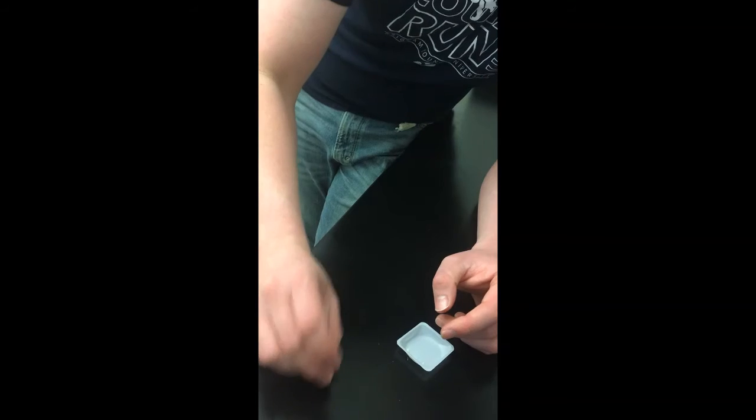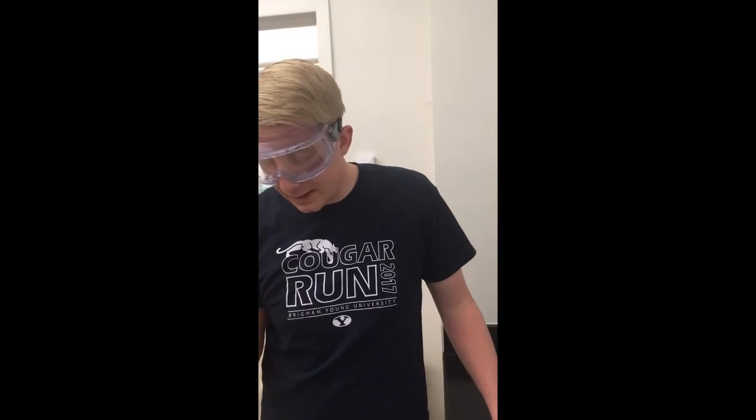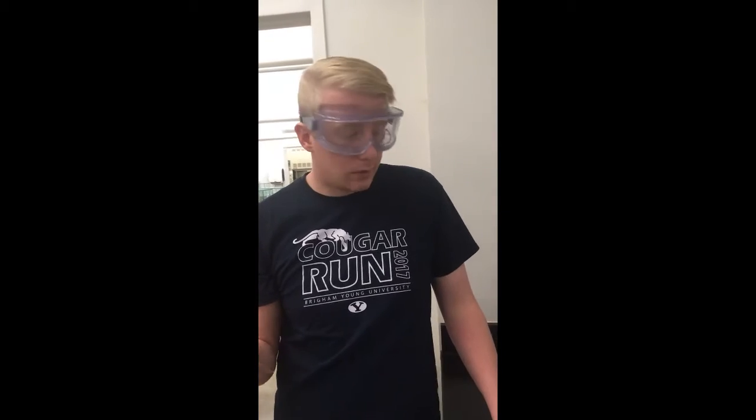Now, what we want is to get approximately 2 millimeters of sample in the bottom of the tube, so that there is probably enough of our compound to be able to get a good melting point. If you have too little, your melting point will be low, and if you have way too much product in there, your melting range is going to be really broad, and you're going to end up recording a higher melting point than you otherwise would have.